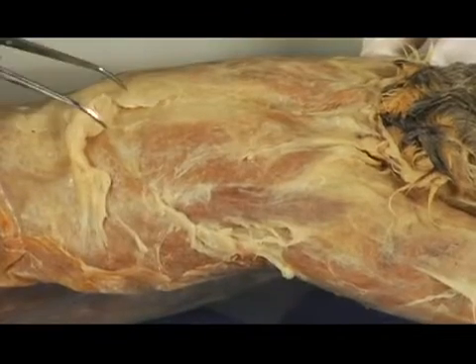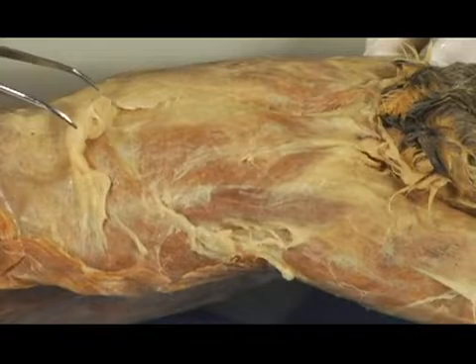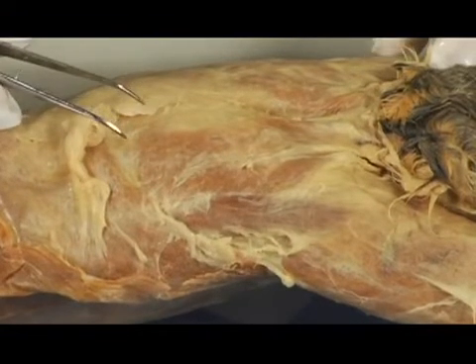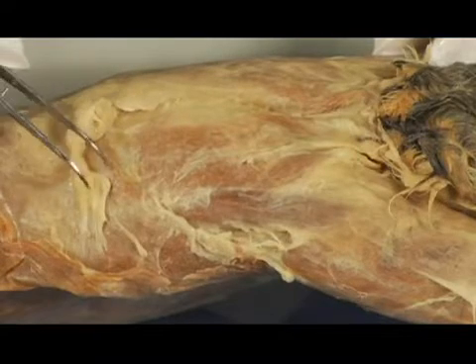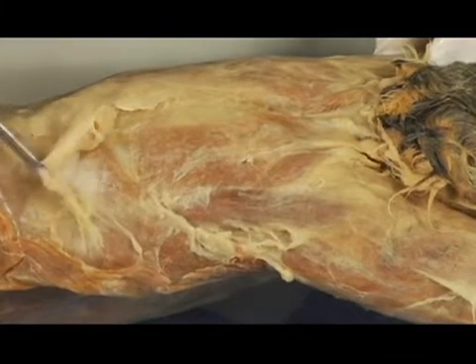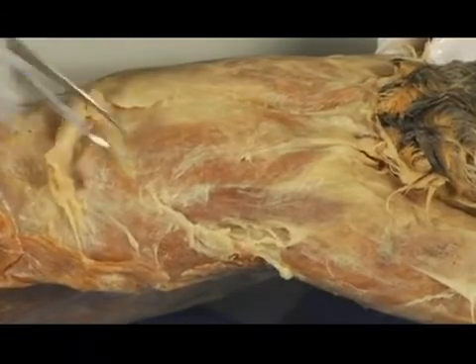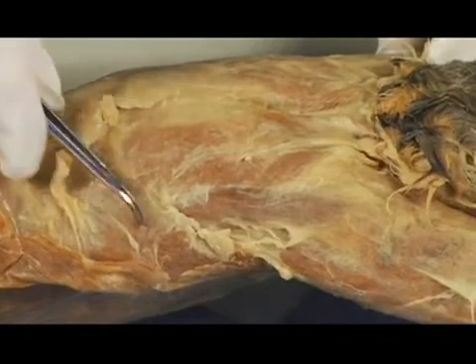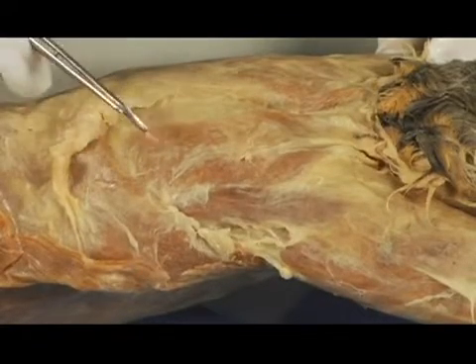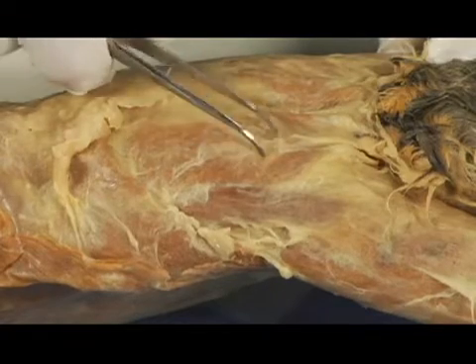Okay, so we're continuing. What I'm going to be doing here in just a minute is name a few of the muscles that we've exposed here with the cat. We've removed enough of the fascia and the fat, and I'm doing a little bit more here now so that we can actually see some defining areas of muscle. You probably can tell now that there's something here, kind of runs along this direction. There's another muscle that seems to come around the shoulder area here.